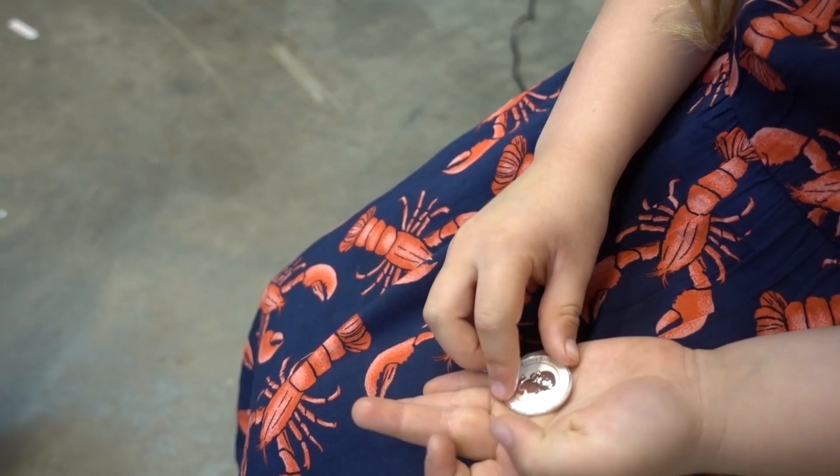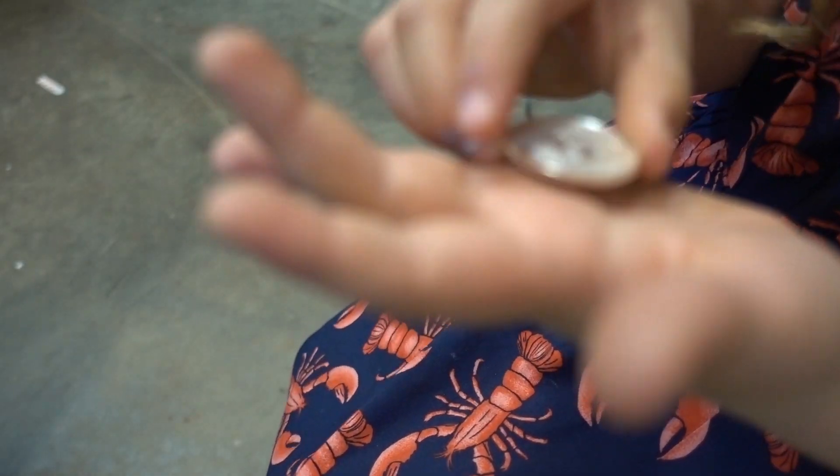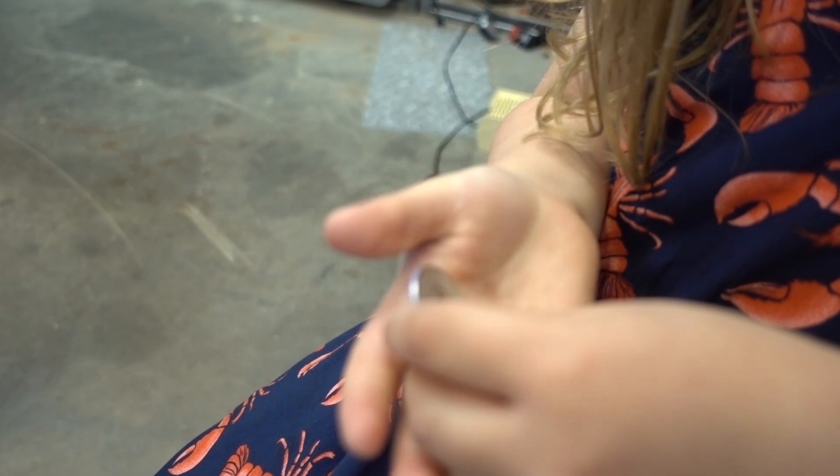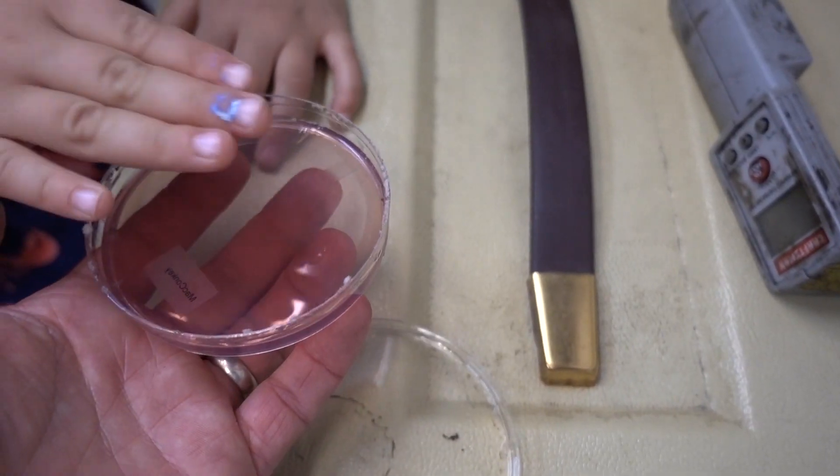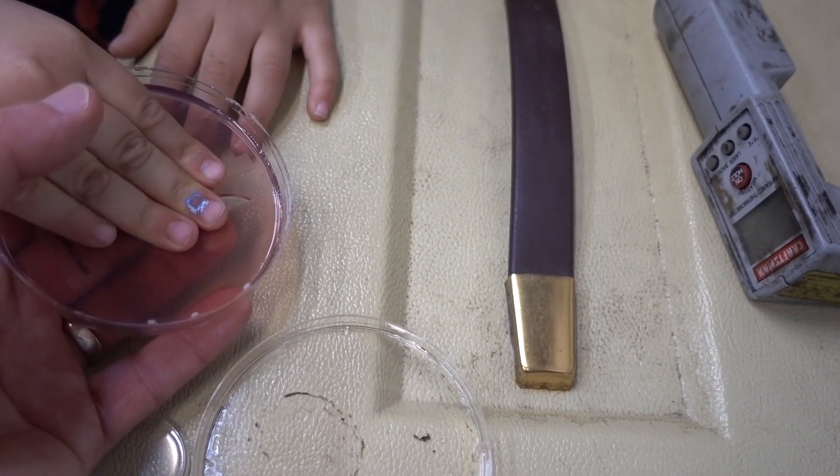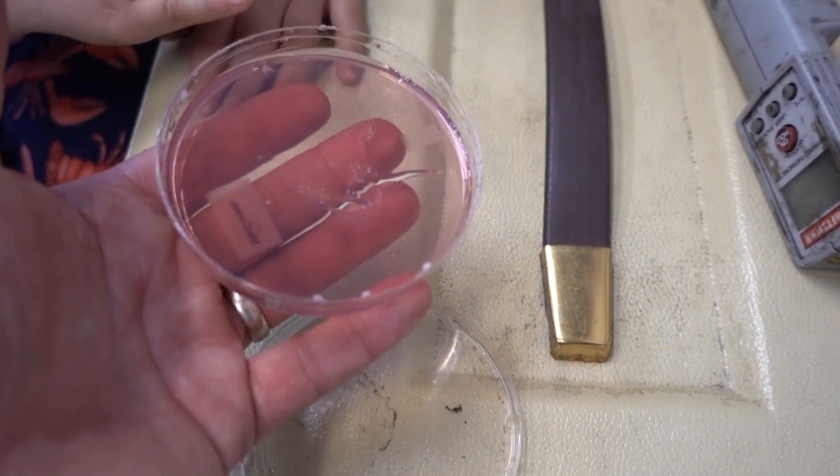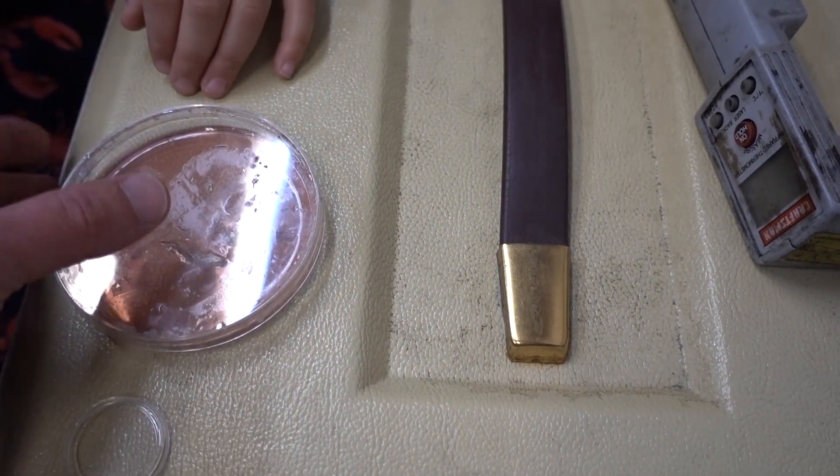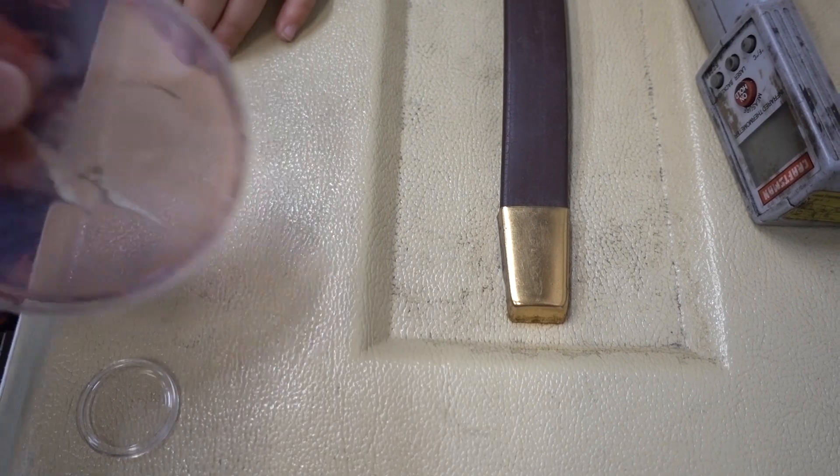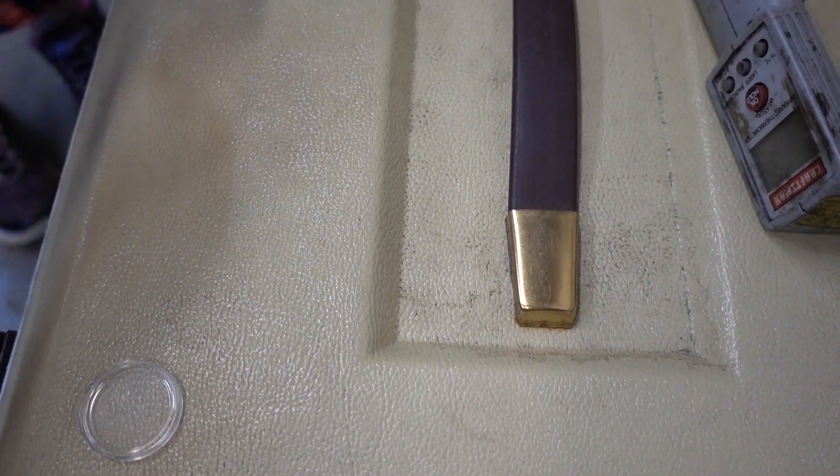What you got there, chicken? A silver coin. The next part of the experiment is to see if rubbing a silver coin in your hand helps reduce the amount of germs. That's good. I made holes in it. Can I keep on doing it? It's fun. Just the once. Okay, now we put it back in the incubator upside down.